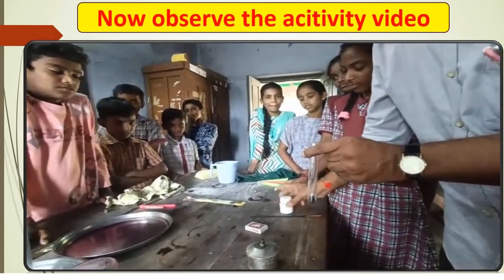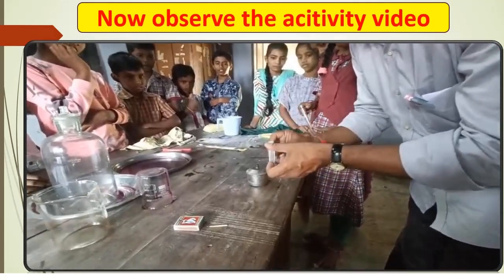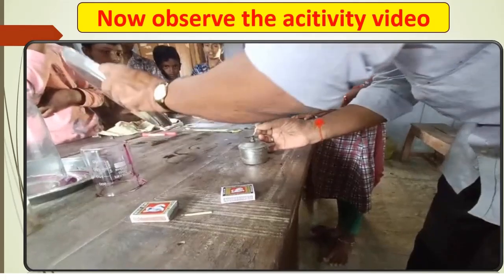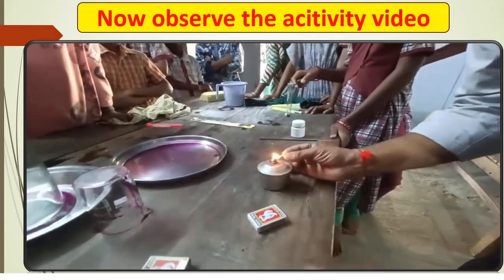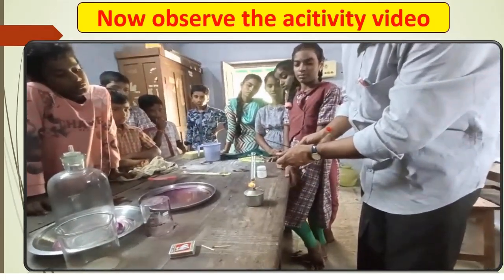Now light the spirit lamp with the help of a matchstick.